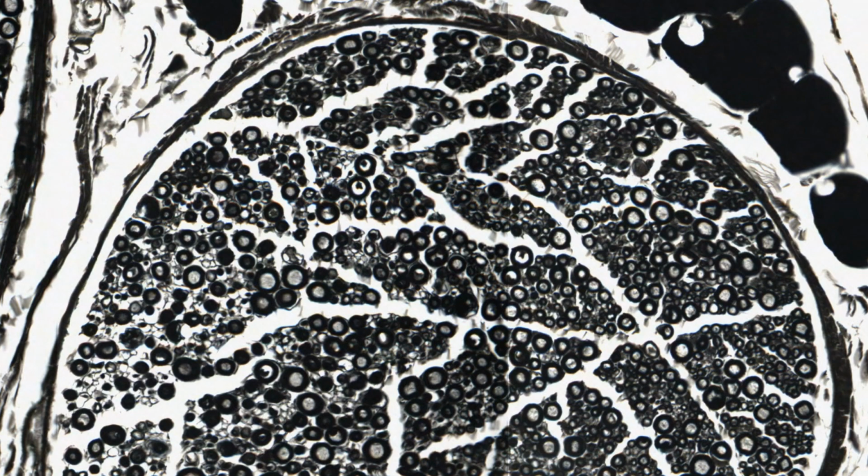This is a section through a peripheral nerve bundle or fascicle, and these white dots are axons that could be sensory or motor nerve fibers travelling long distances. All this dark surround is myelin, which is secreted by a supporting cell called the Schwann cell. And as I said earlier, this myelin helps to insulate the cell process, the axon.